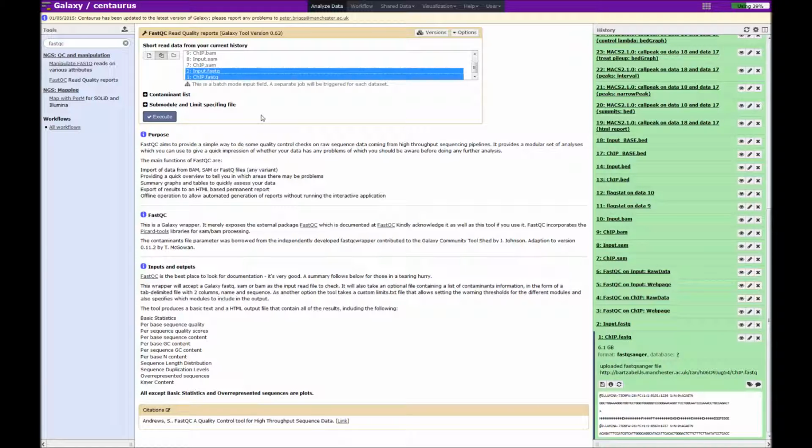And that is all we need to run the analysis. So all you do is click execute and wait for the results. Then what you would see is these files appear, and when they're completed they turn green.